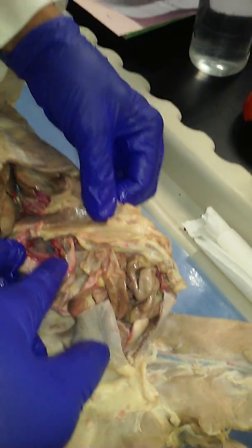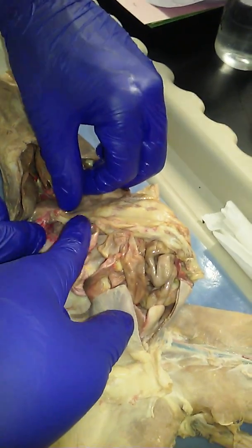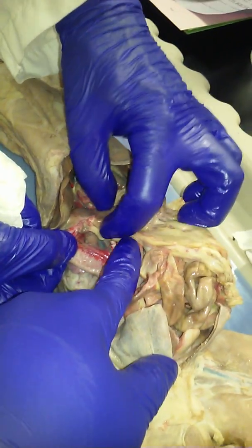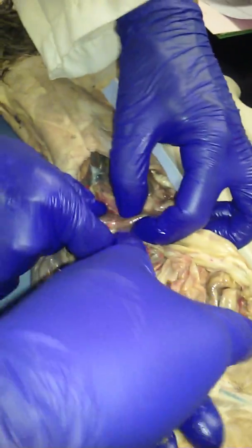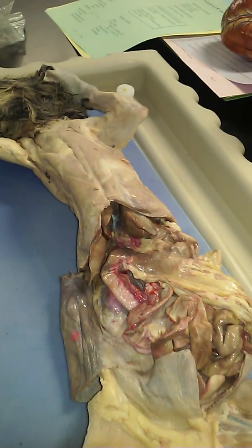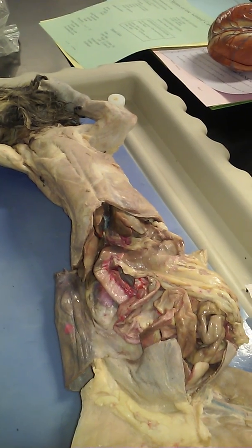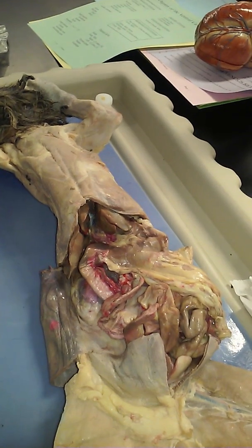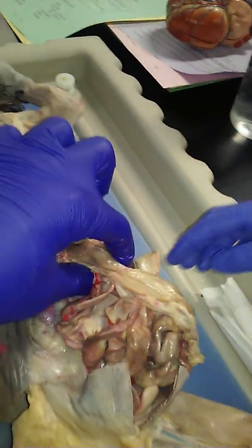Here's the intestine. Here's the stomach. Here's the pylorus. Here's the small intestine. Right. That little bit of fat right there. There's only fat there because there's a little dent where the muscle cinches. And so the shape of the stomach goes down into that little cinch, and then fat is in that little valley.